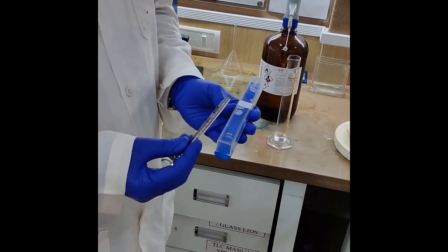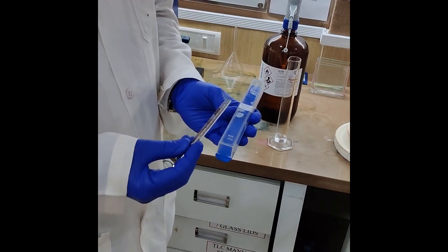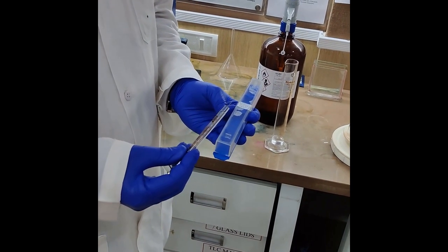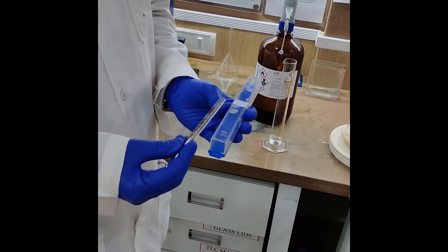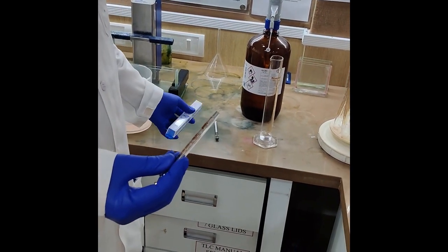Many times we get this problem when we are doing analysis because of some minor mistakes, like forgetting to rinse the syringe after application is done. However, today we are going to see how to troubleshoot such a blocked syringe.